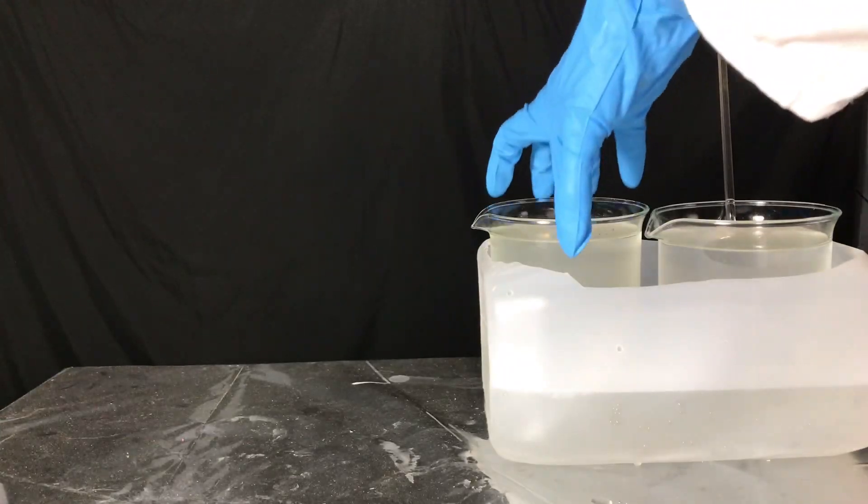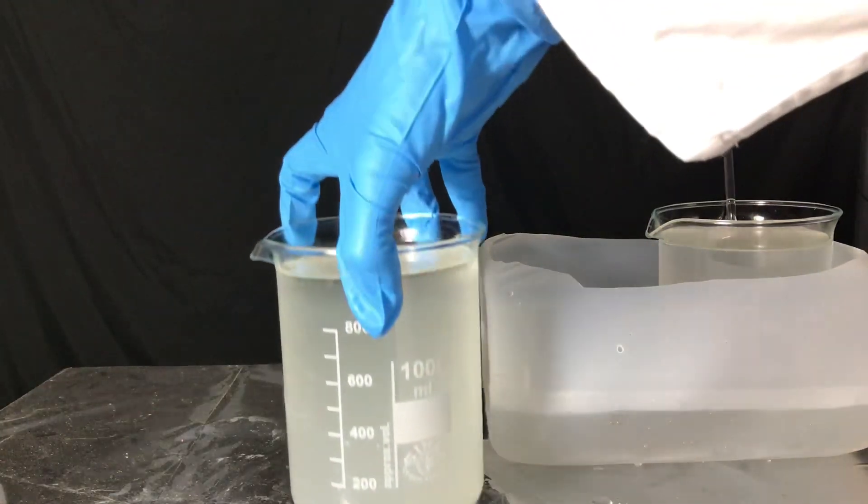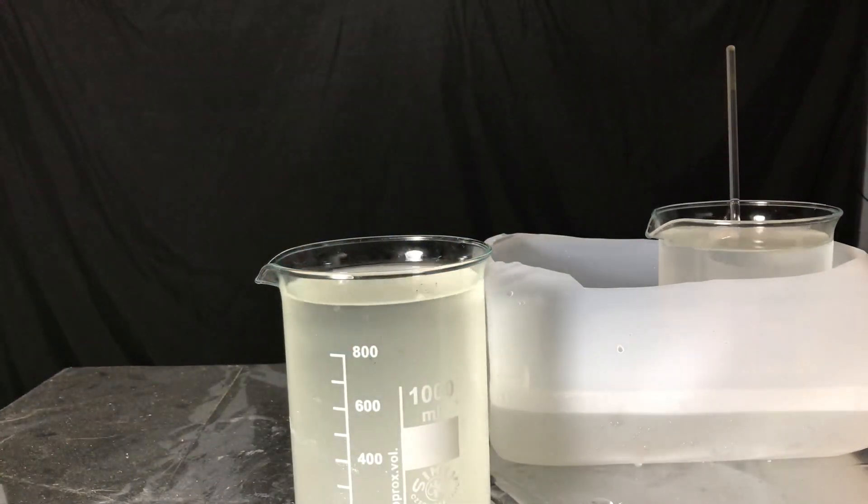Two hours later we took out one of the beakers and what was nice was that a clear visible layer had settled on the bottom.